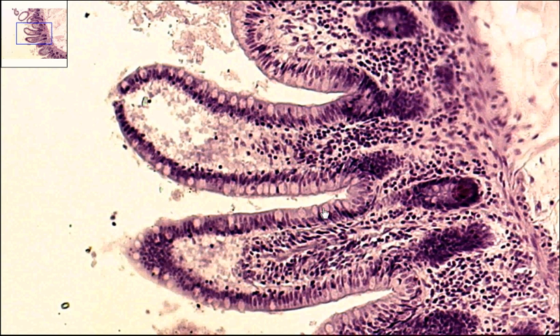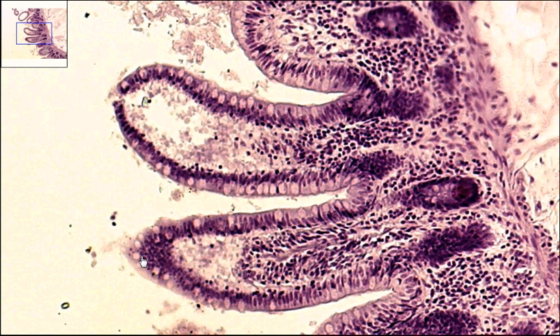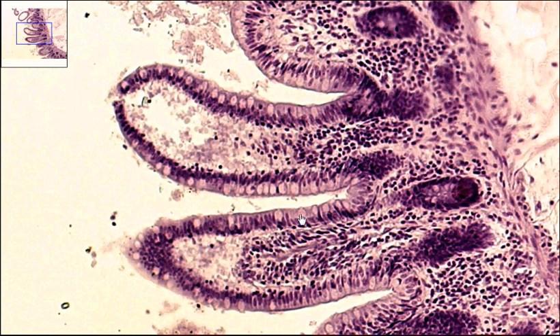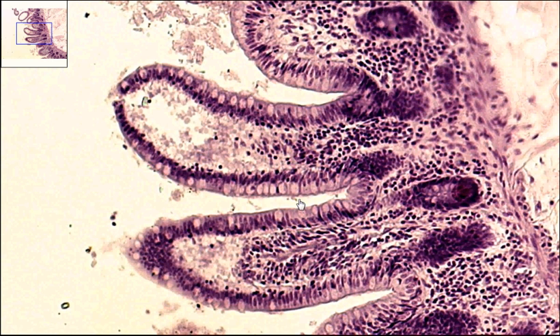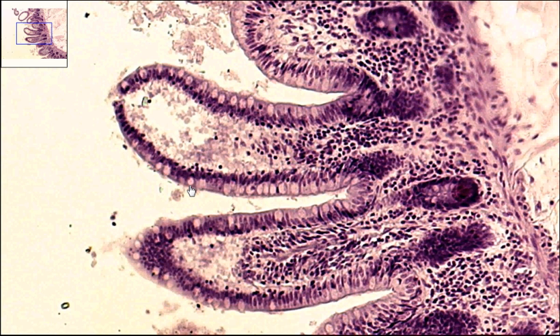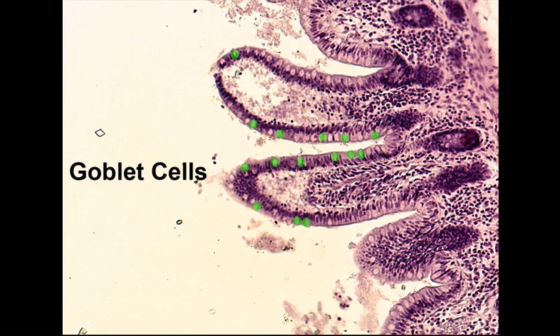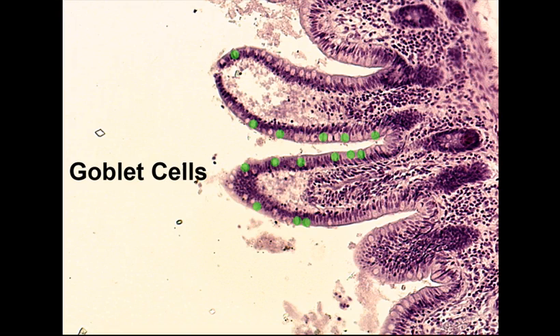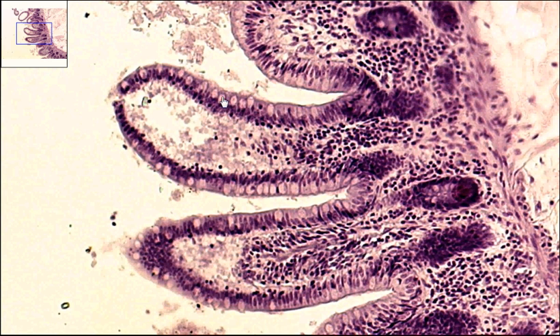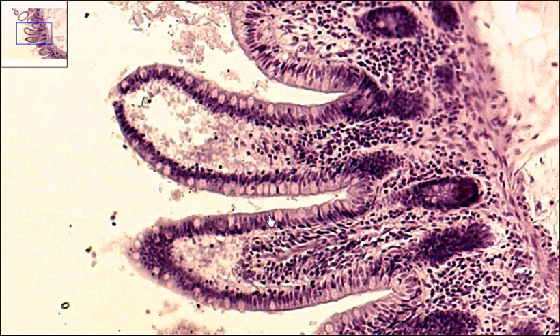So we have our simple columnar epithelium, which, as I said, includes goblet cells. These roughly round structures here — you can see there's quite a few of them — those are your goblet cells. They're meant to produce mucus. So we have our simple columnar epithelium with goblet cells.